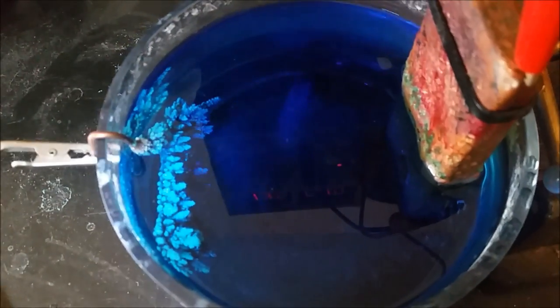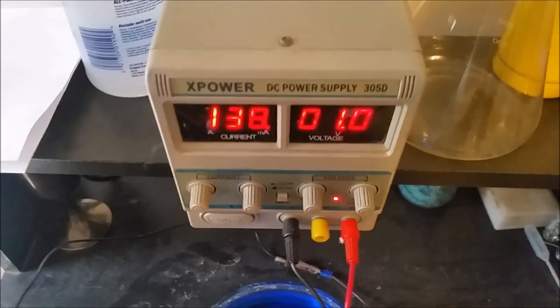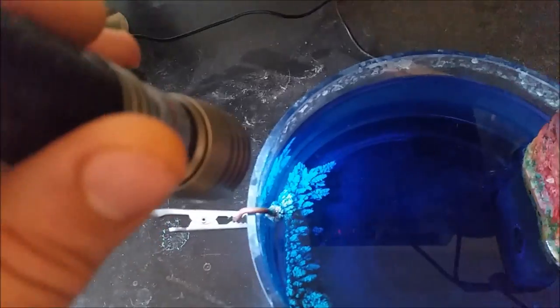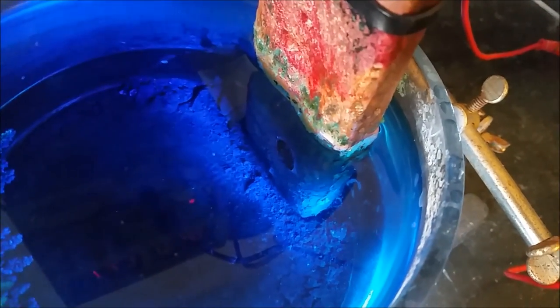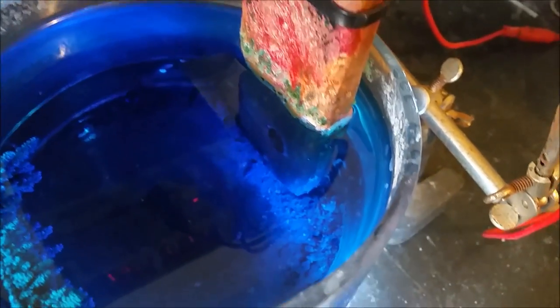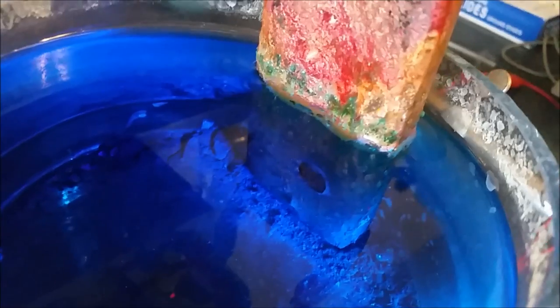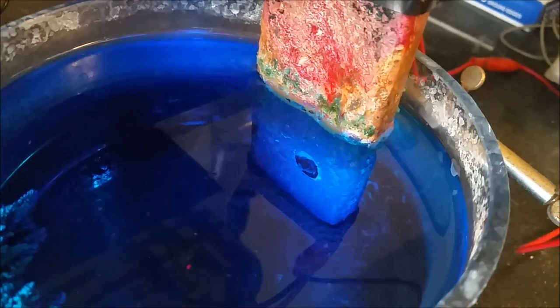These are the crystals at about the two-week mark. You can see they're really starting to grow out. As the crystals grow, the power consumption increases a little bit — it's using about 138 milliamps, between 130 and 140 milliamps. I dropped the voltage down to 1 volt just so these thicken up a little bit so they don't become too thin. You can see on the anode it's getting eaten away — all the dust at the bottom is copper oxides, flux from the bar, and metals that aren't copper. There's also a hole being eaten in it, and I'm not sure why, but we'll get a better look once we pull it out.